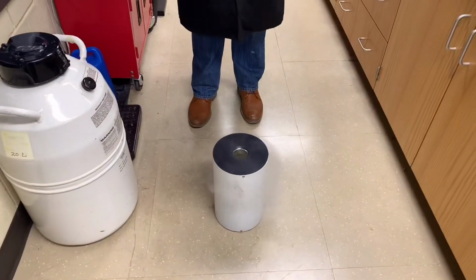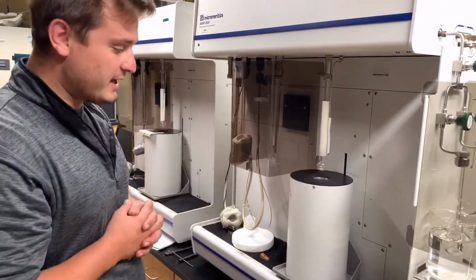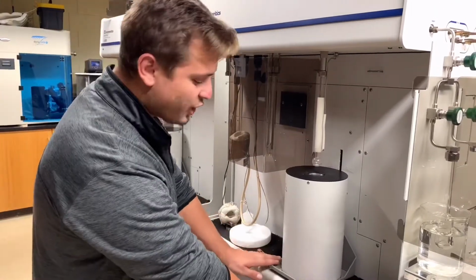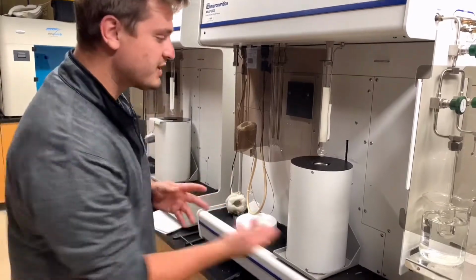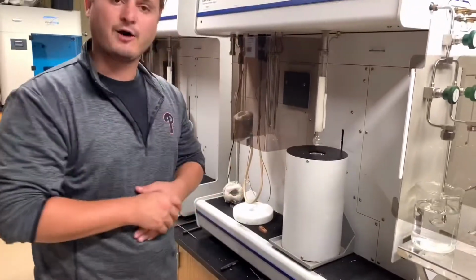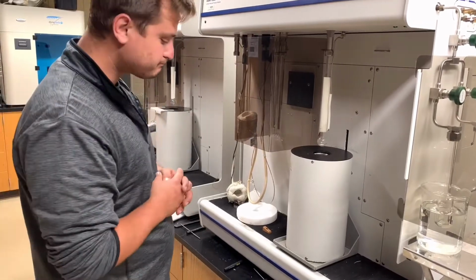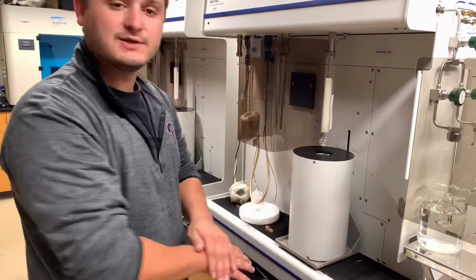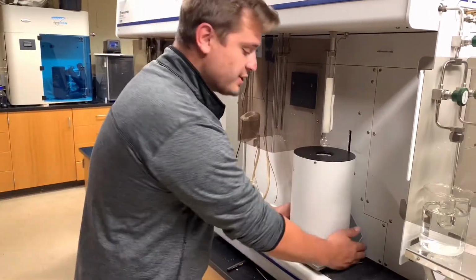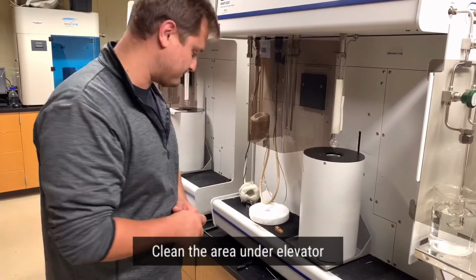Okay. So now that the liquid nitrogen dewar is full, we have put it here on this stage. This is an elevator, or a stage, that will raise up and lower down depending on what part of the sample analysis we are on. It is very important to maintain a clear and item-free area underneath the elevator so that it can properly raise and lower at all times.